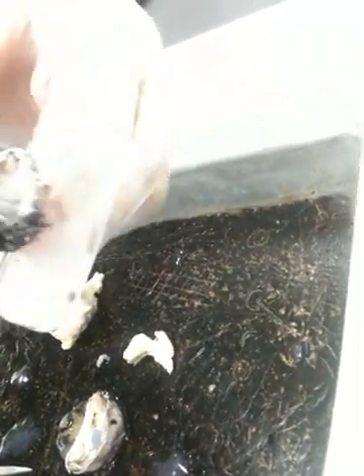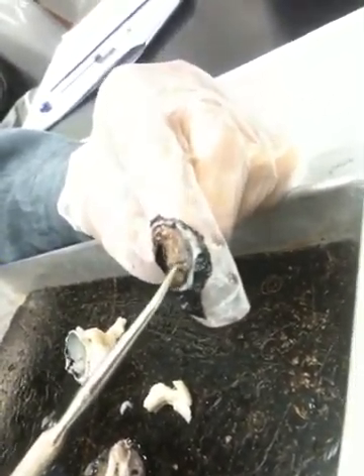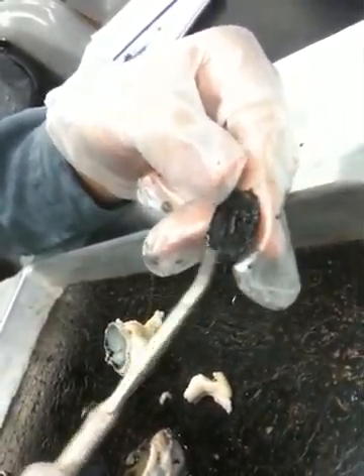If you flip it around, do you see a brown ring on the other side? Yeah. What is that brown ring surrounding the pupil on the other side? That is the iris. So on one side you can see the iris. On the other side you can see the ciliary body.